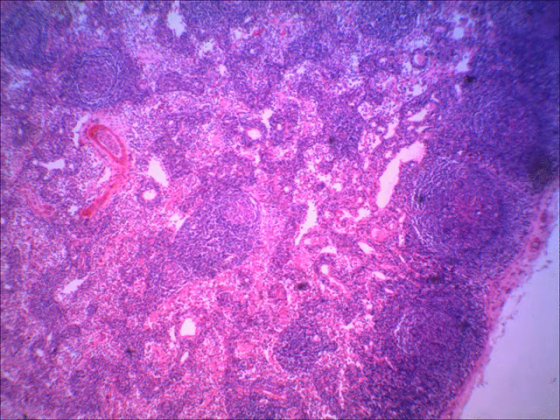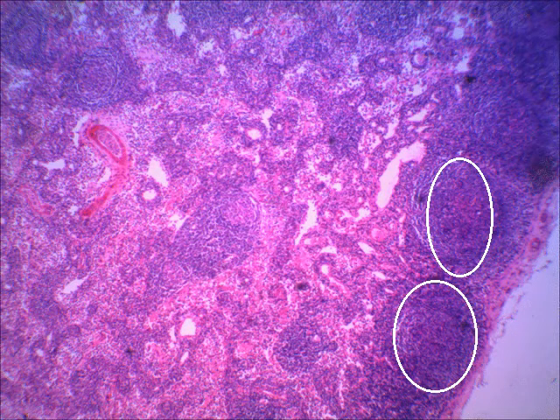All right, now if you'll look at what I'm encircling, that area, I know that circle's not quite big enough, but in these areas, you see the lymph nodules. Those lymph nodules are mostly made of lymphocytes. Later, when we put this on a little bit higher power, you'll be able to see the lymphocytes. So those would be the lymph nodules. You might see some more, but usually these are up close to the capsule, to the surface of it. But wherever you have these real tight clusters of lymphocytes, which stain darkly using this blood stain, then you'll be able to see those lymph nodules.